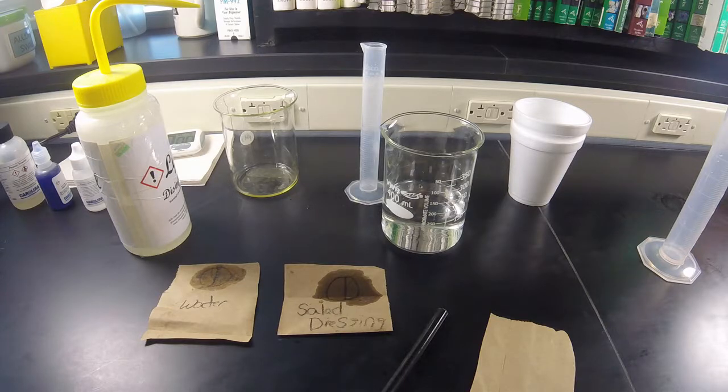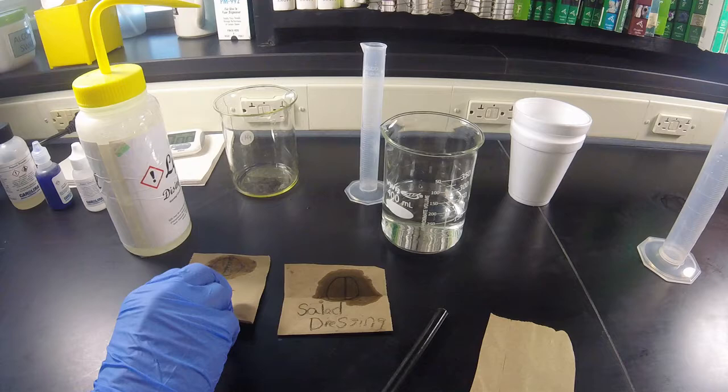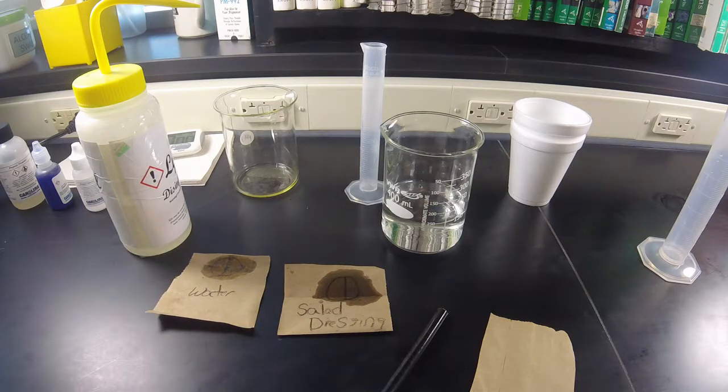After the 15 minutes has elapsed, turn over each piece of brown paper to visualize the results. Record these results in Data Table 3, Positive or Negative Reaction. Please photograph the 8 pieces of brown paper as a group for comparison.